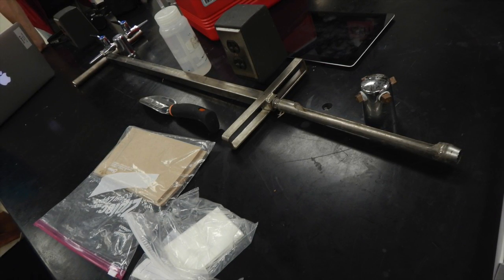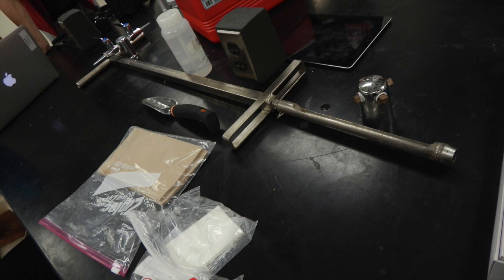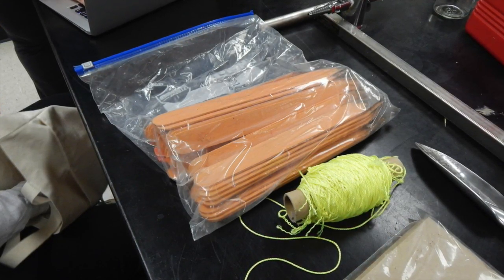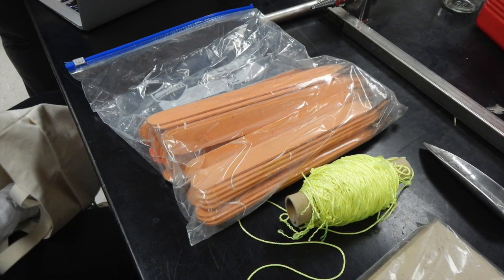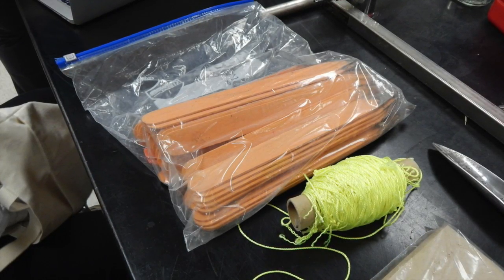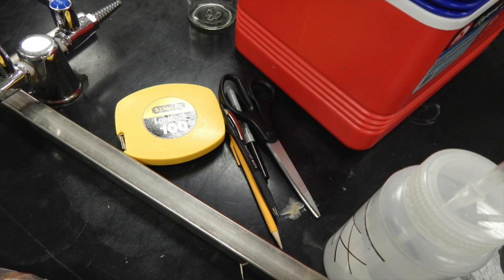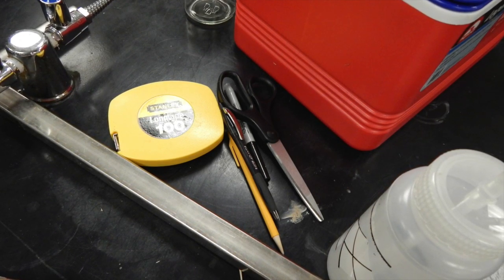The equipment used for this soil sampling method consisted of the following: a plot plan, string, a random number generator, tape, survey stakes, a camera, appropriate sized glass sample containers for sample collection, Ziploc plastic bags, paper towels, logbooks, labels, chain of custody records and custody seals, field data sheets, sample labels, ice cooler, an ice pack, deionized water, a trowel, and a T-handle auger.